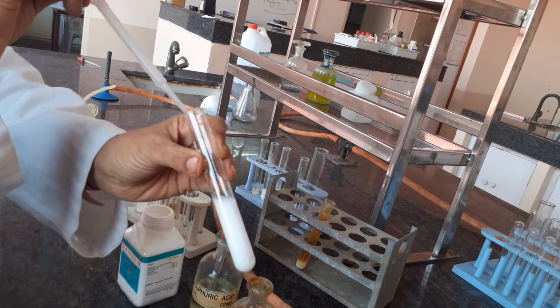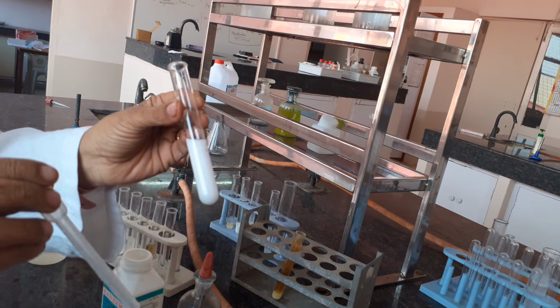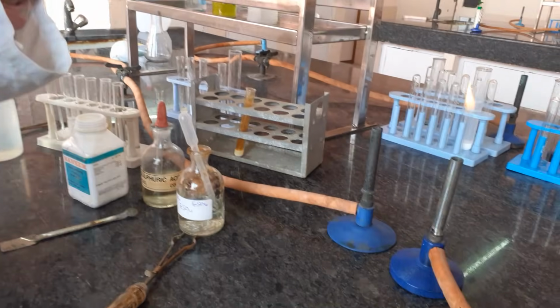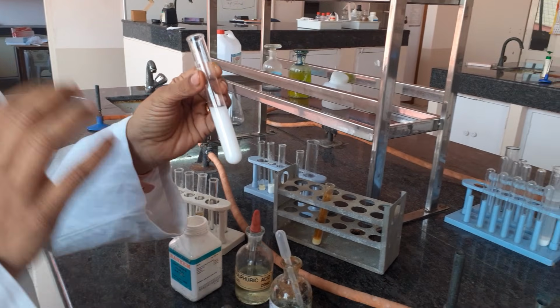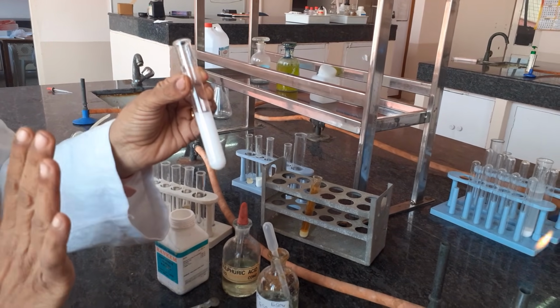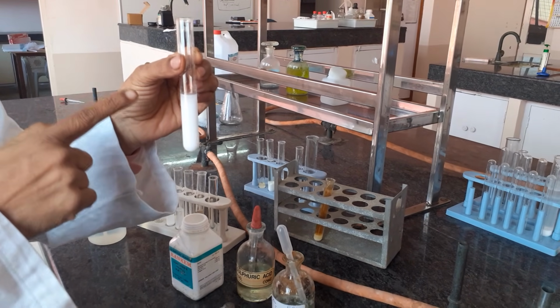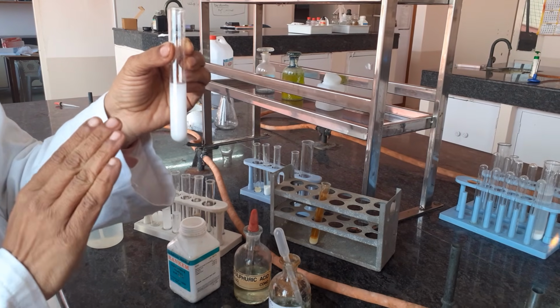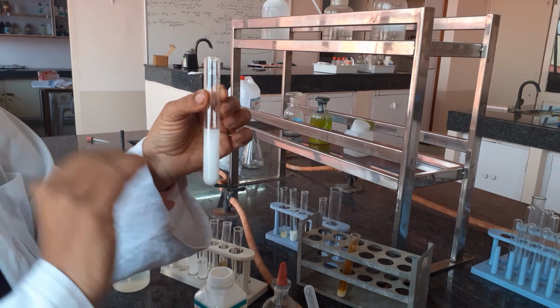Can you see, you are getting a white ppt. That's the problem. If you get a white ppt on adding ferrous sulfate, it means your salt either has lead or one of the cations from group five. That is an indication. Now if you try to do the brown ring in this, it is going to be really tough, so what I advise is please keep it for some time.